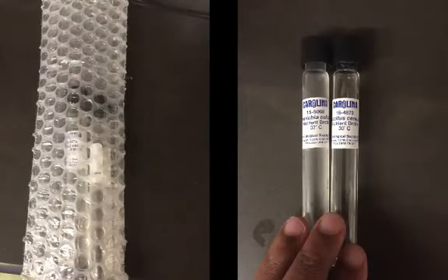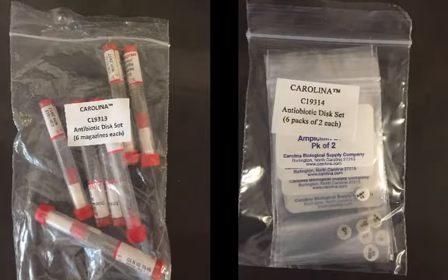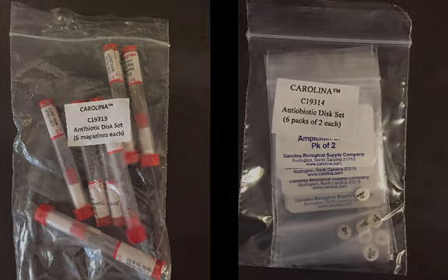Locate the glass vials with the E. coli and B. cereus bacteria. I would have the teacher put 2 to 3 drops of the bacteria onto the agar plates for you. Use forceps to remove antibiotic discs from the bottom of these vials, or just to remove them from plastic bags.